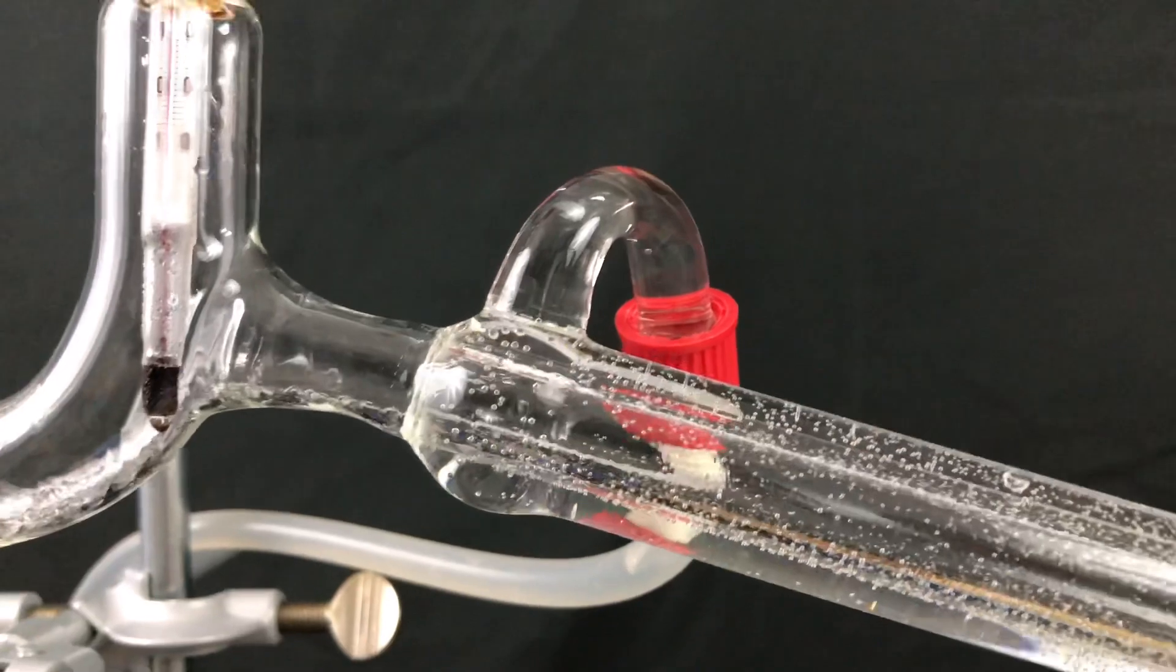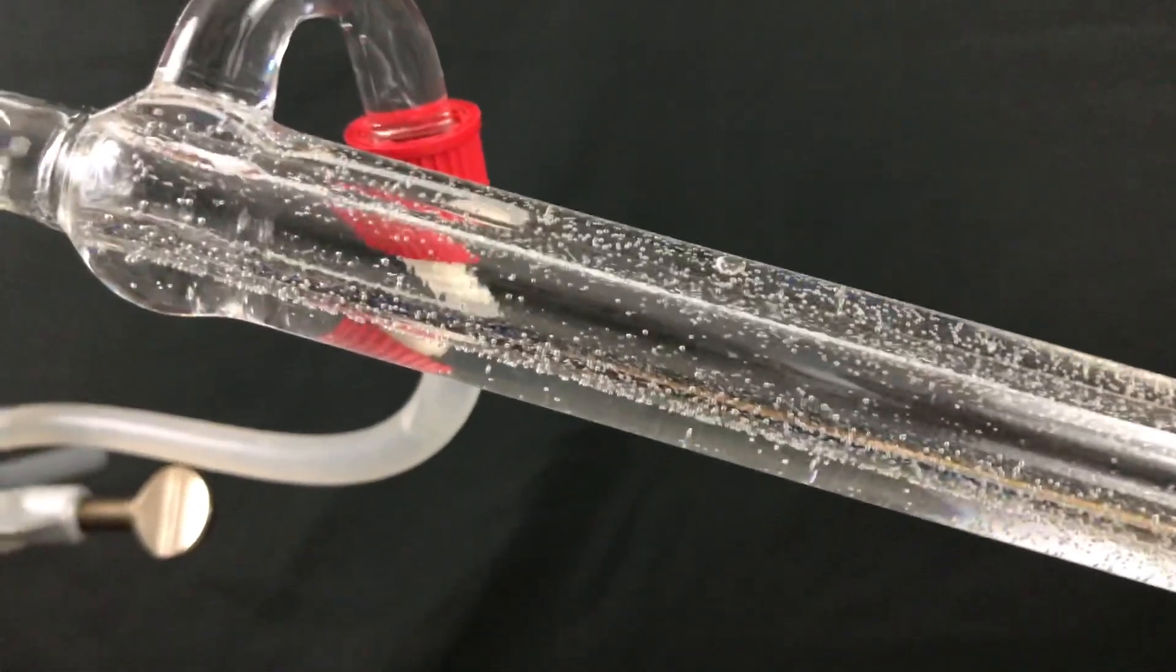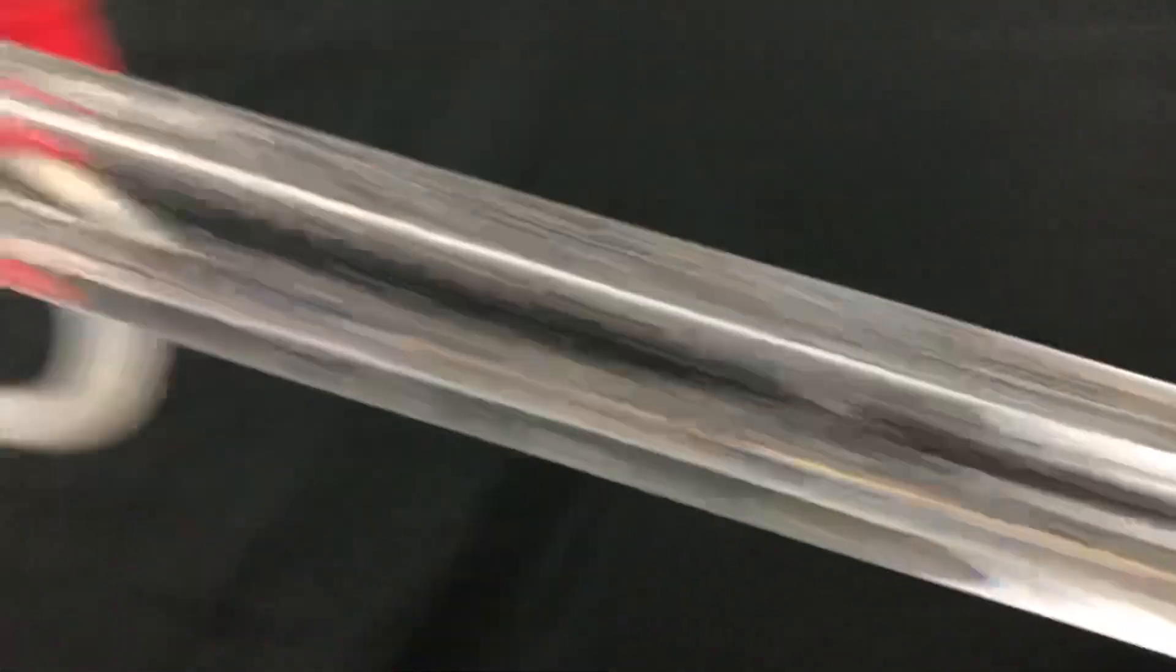And here comes the moment all of us have waited for. Here comes the first drop of our nice and clean 1,4-dioxane.